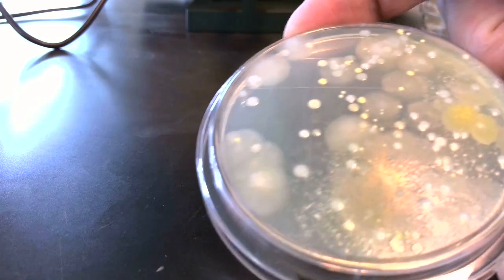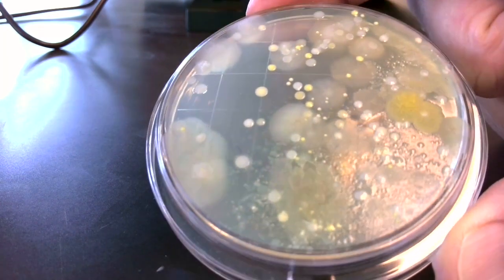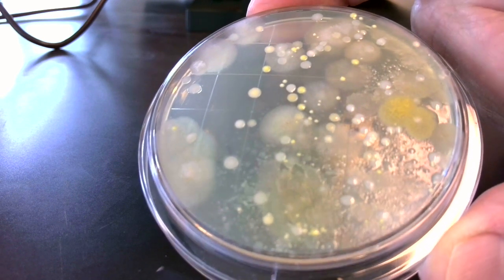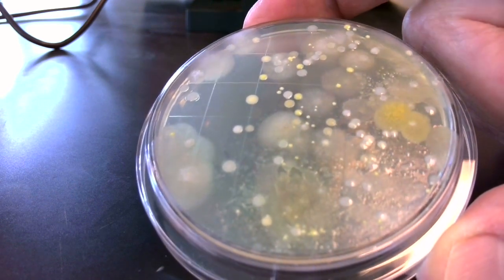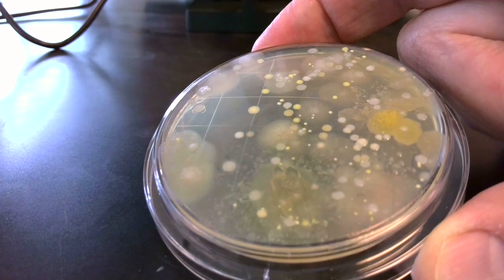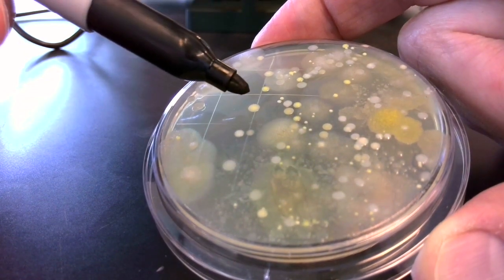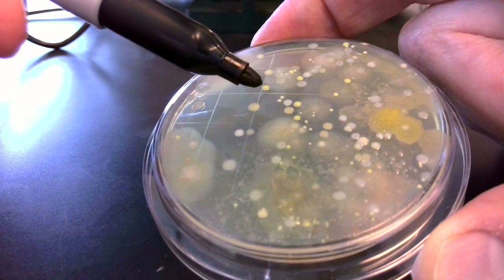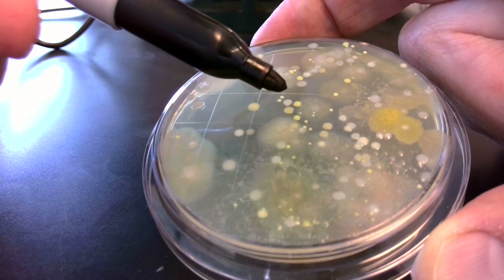So let's take a look at what bacterial colonies and mold mycelia look like in real time. Remember, last week we took a sample from the sink in the culinary lab, right? And from that sink, we actually were able to grow out many different kinds of microbes. Those formed these colonies that look something like these shiny ones or these yellow ones, small and large.